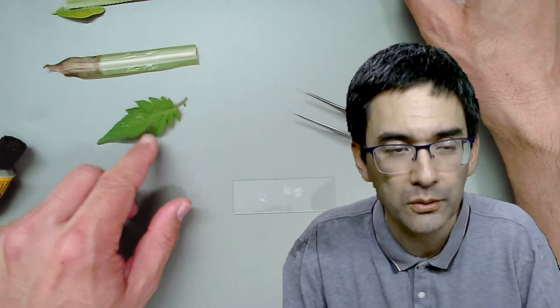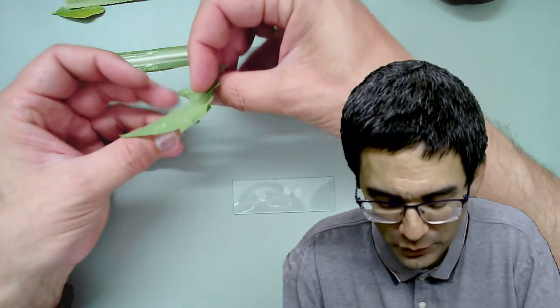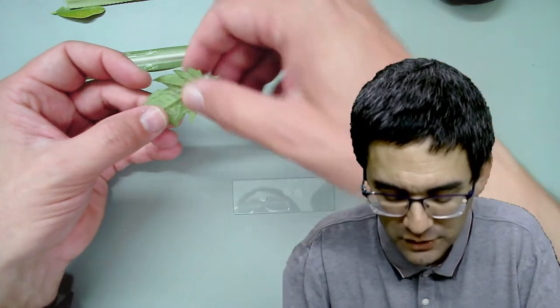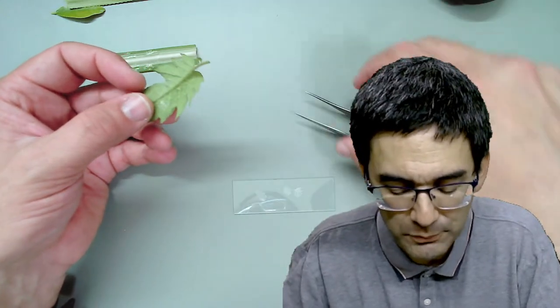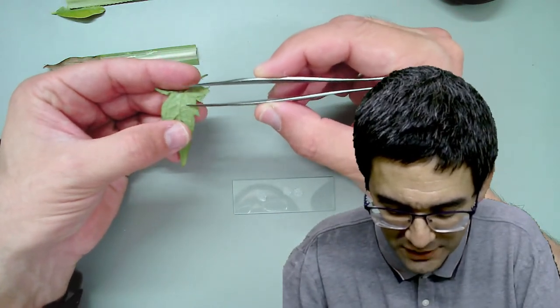Here, quite nicely visible. In other words, it's not necessary to make a very thin cut - it's possible to make impressions of the leaves. So I still have two more leaves. Let's try this difficult one - a tomato. I'm growing some tomatoes on the balcony. I put a little bit of glue on the top and also on the bottom surface.